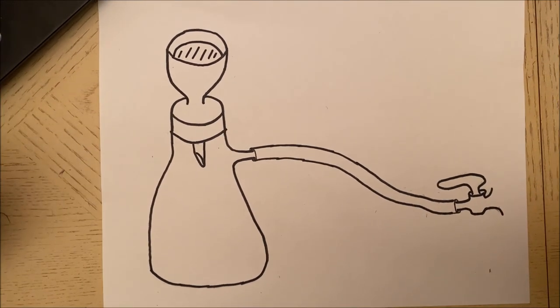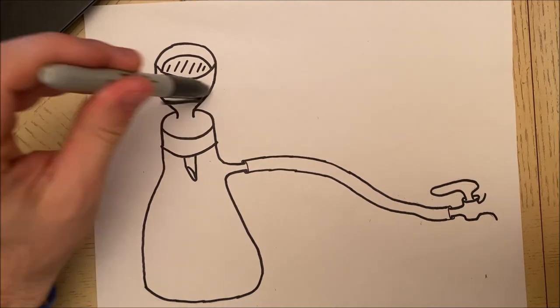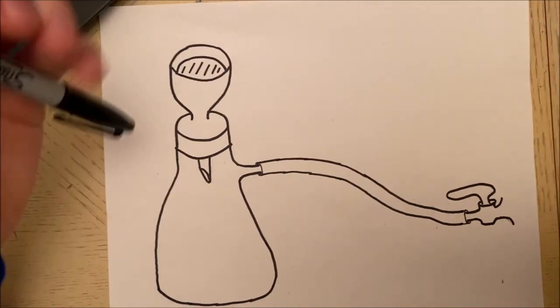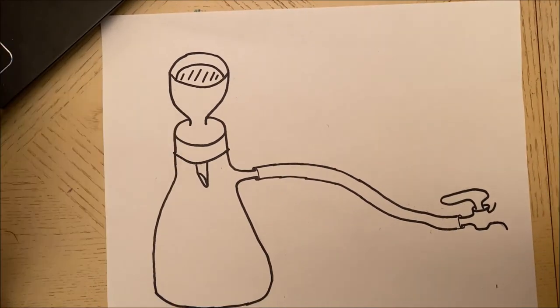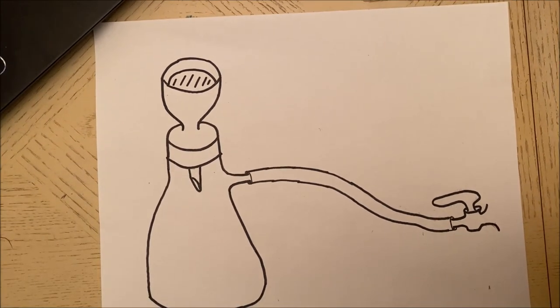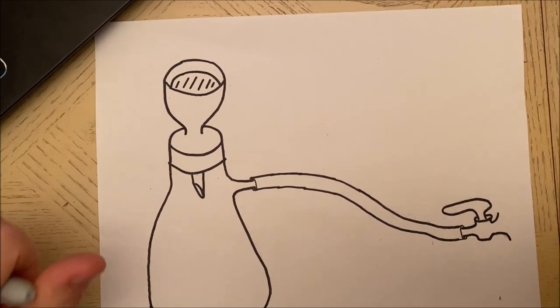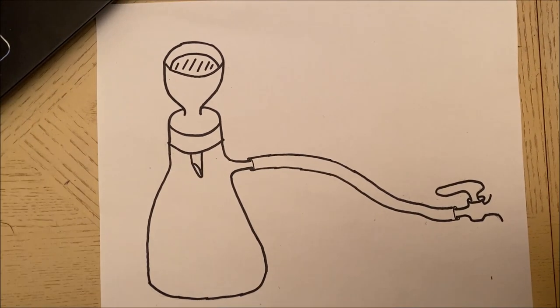You can pull - usually most of these have a disconnect at this point where you can just pull it off and you can take the filter paper with you and you will have your solid. To disconnect, we're going to turn off the vacuum source, pull the tubing out of everything and clean it. And that is how you do vacuum filtration.